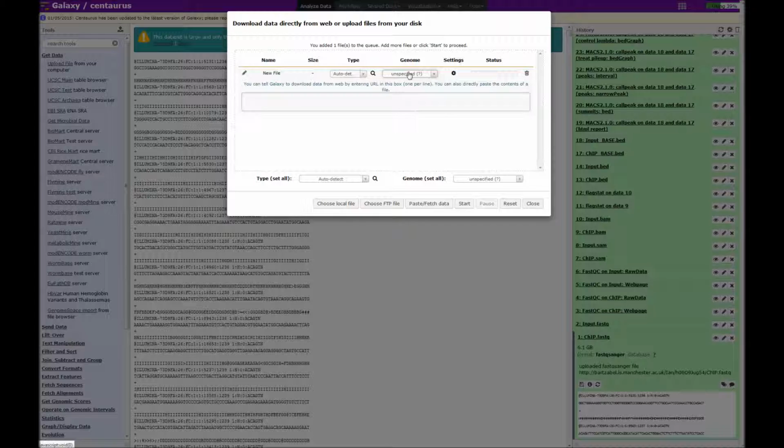If you're working for a university or a company, you might have easy access to a web server. However, if you're not so lucky, it's also possible to host files on other web servers such as Dropbox.